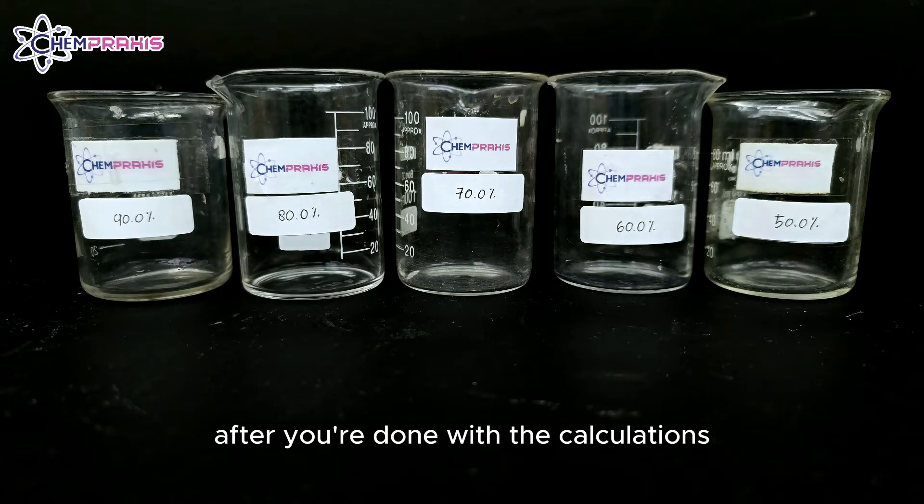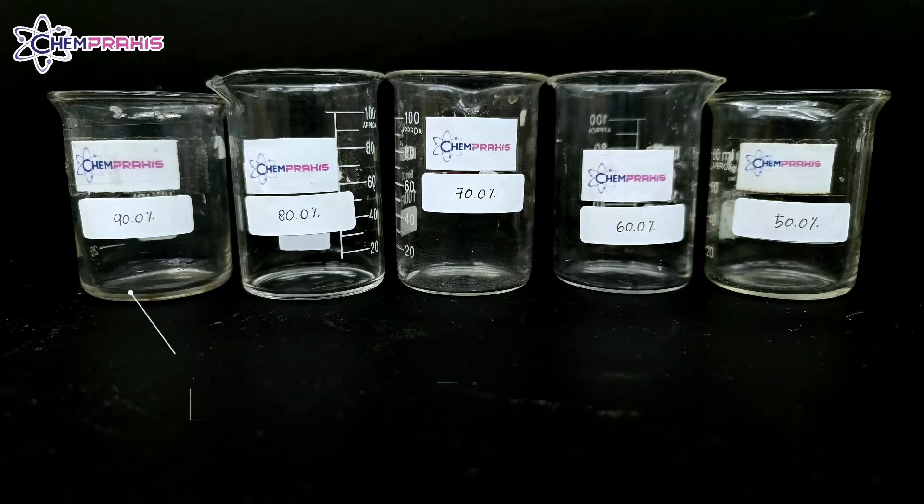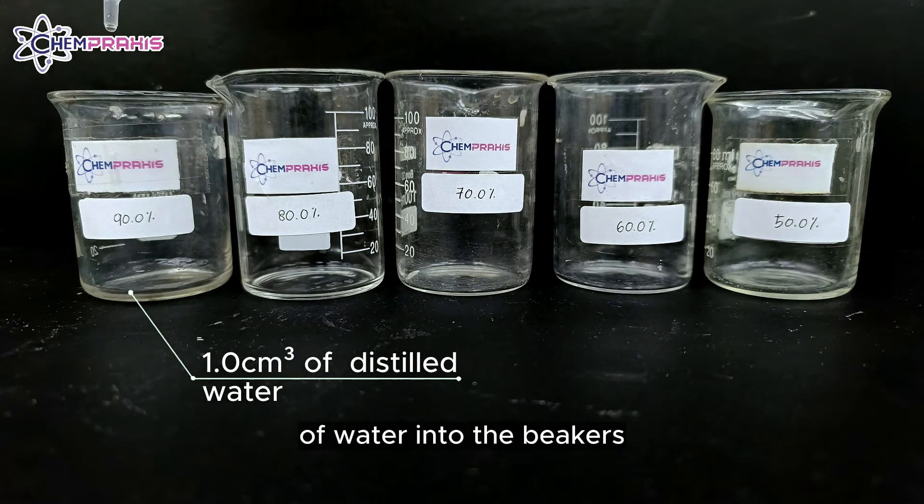After we're done with the calculations, we can start adding in the solutions into the beaker. First, I'll add in all of the calculated volumes of water into the beakers.